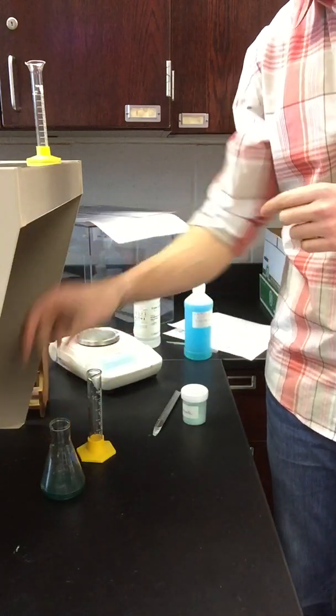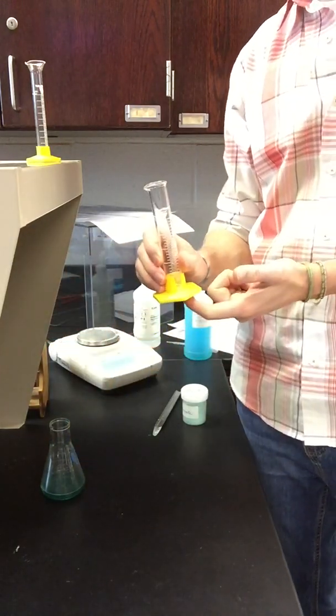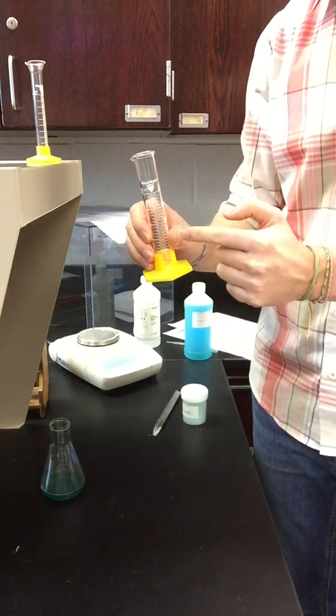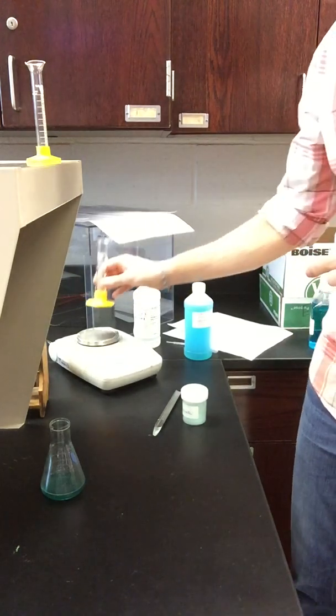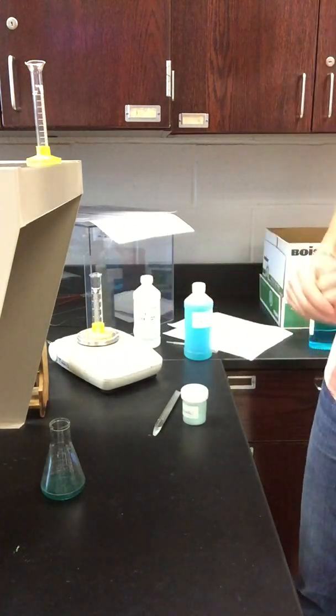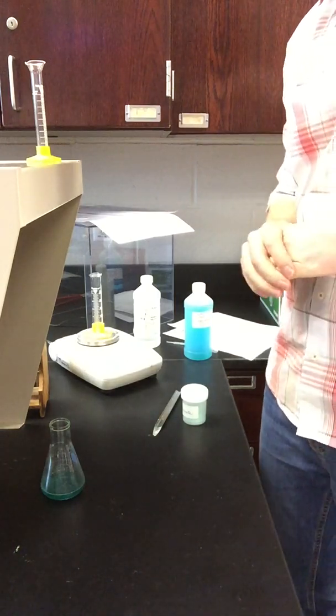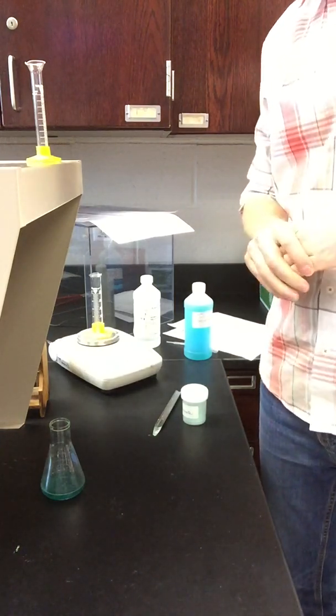In the meantime, let's get some more data. So the graduated cylinder did have acid in it. Remember, I gave you a mass of the cylinder with acid. If I give you the mass of the cylinder, then we can get the mass of the acid. So the mass of the cylinder by itself is 46.739 grams.